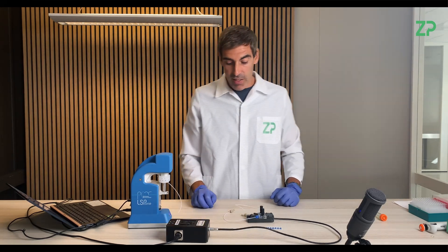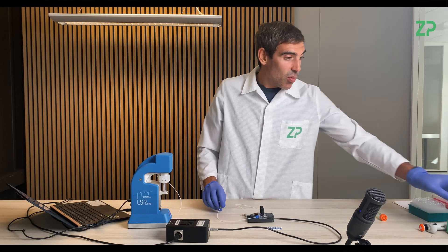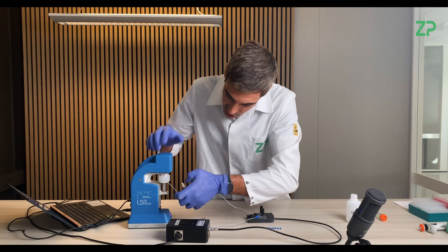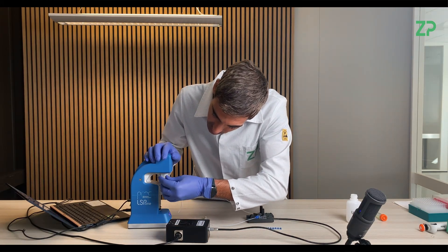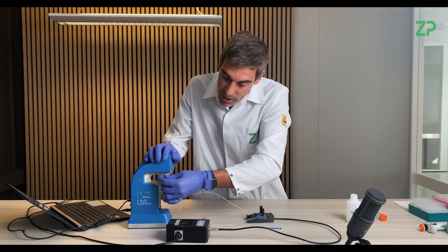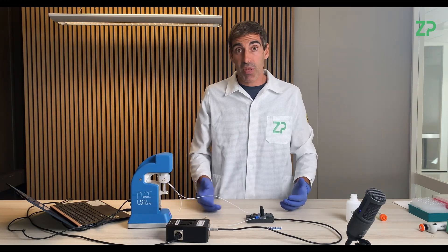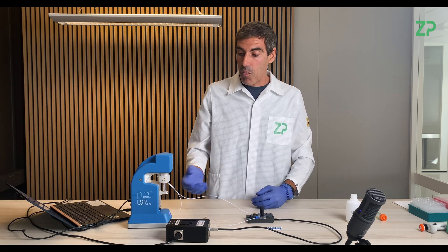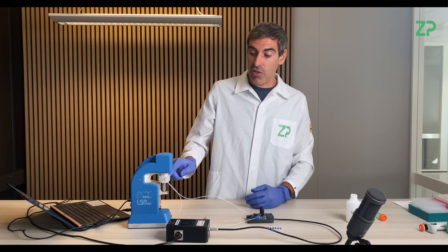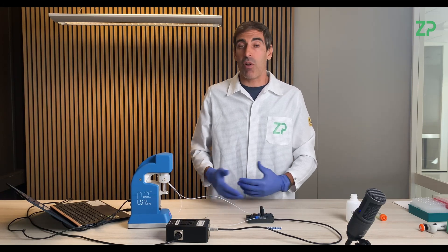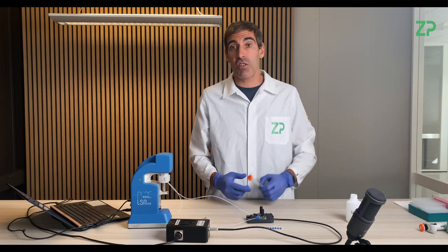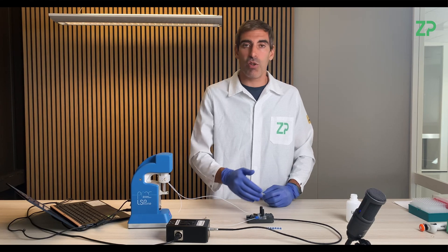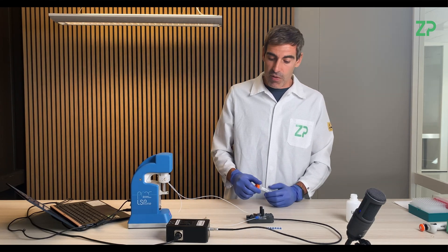Then we need a waste. So we will flow from one channel in the pump. I will choose just channel 8 to have a system like this. The advantage is you can do a continuous test where you can pump different samples onto your sensor by aspirating from different channels on this pump, by aspirating from different beakers or different centrifuge tubes. And like that, you can run a constant test where you switch between different solutions. So it's a very powerful setup.